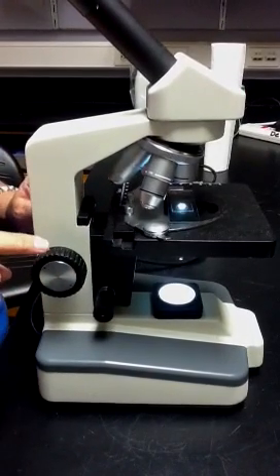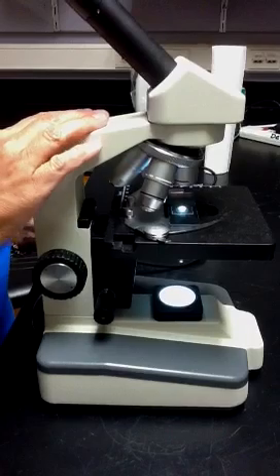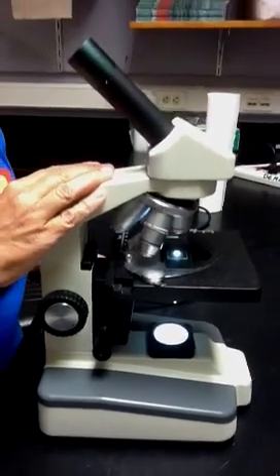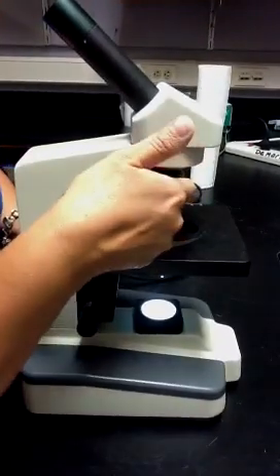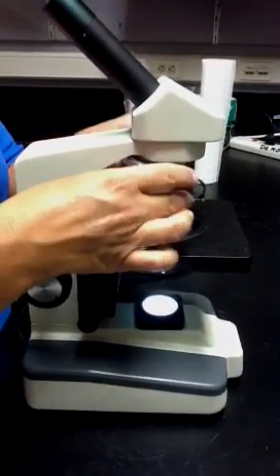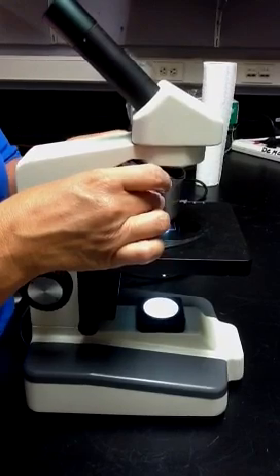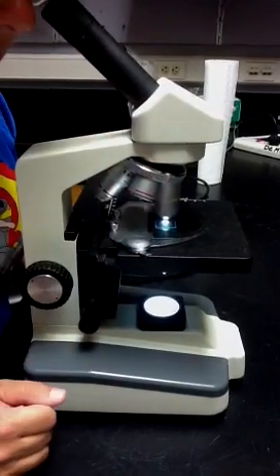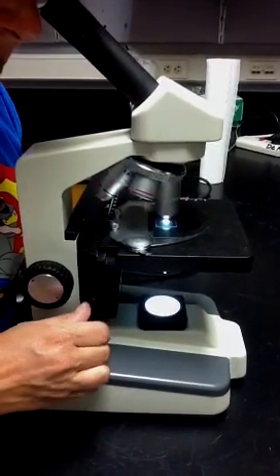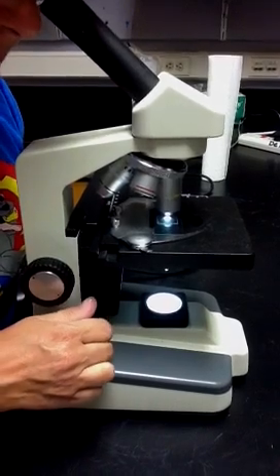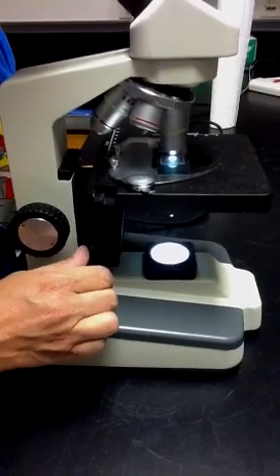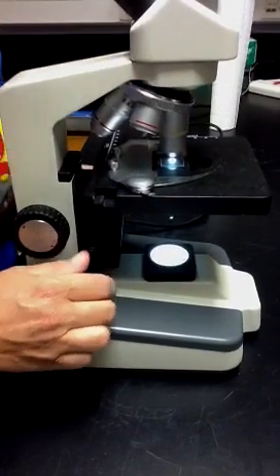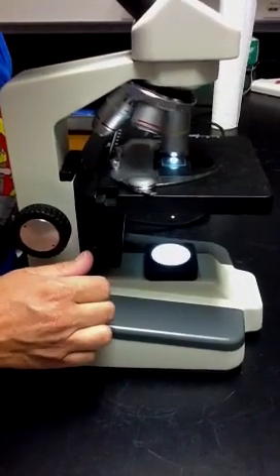The reason why these microscopes are so valuable and so expensive is once you focus your specimen using the 4x objective lens, all you do is rotate the next objective lens in, click it into place, look through the eyepiece, and you should just have to make minor movements with this fine focus knob to bring your sample into place. I exaggerated it there, but really, I only have to make very small movements.